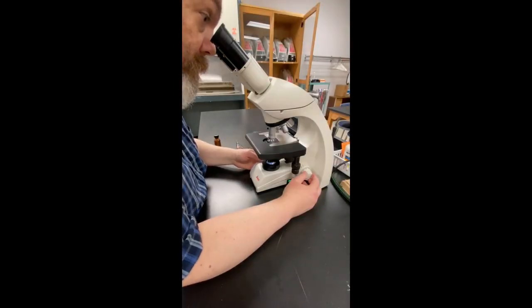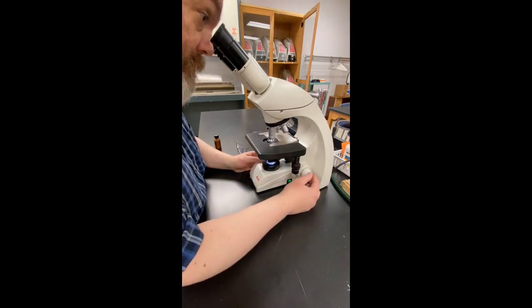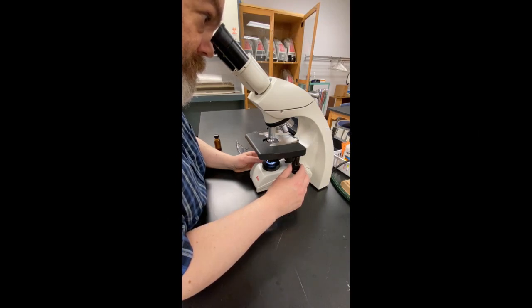Only use the fine focus control when the oil immersion lens is in place. The oil immersion lens has a magnification factor of 100 times, so combined with the 10 times magnification of the ocular lens, we have a total magnification of 1000 times.